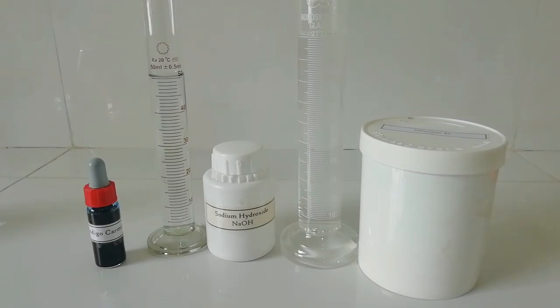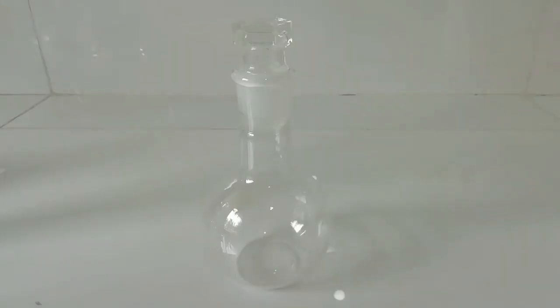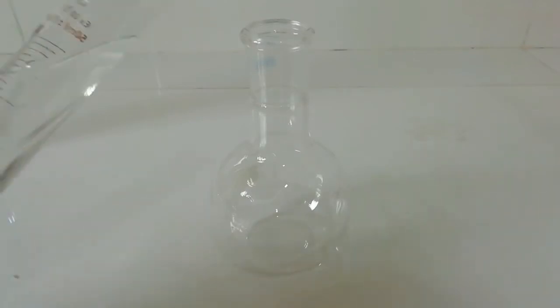For this experiment we need a flask with a lid. If you don't have a flask like this you can use an empty plastic bottle. First I am going to add sodium hydroxide solution.